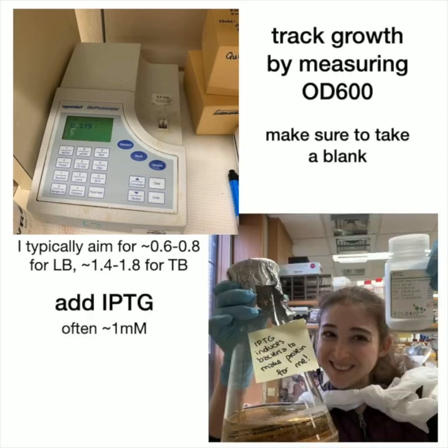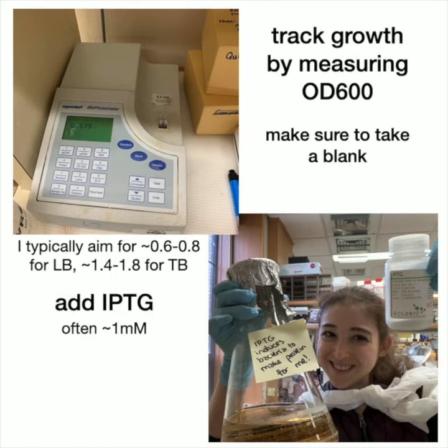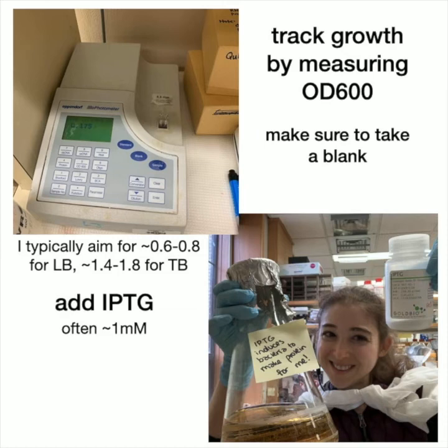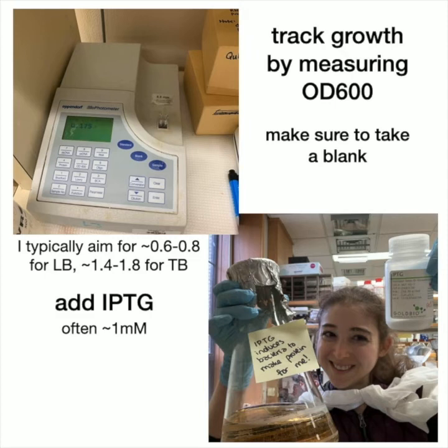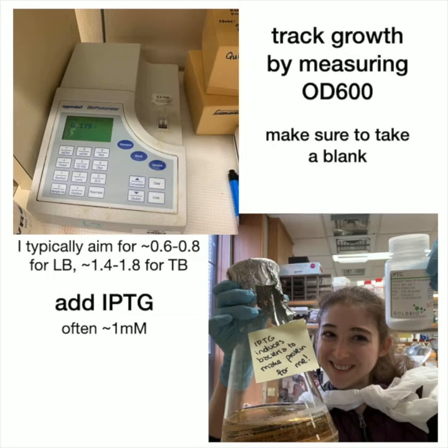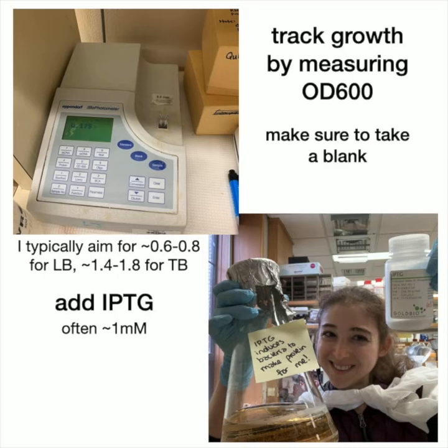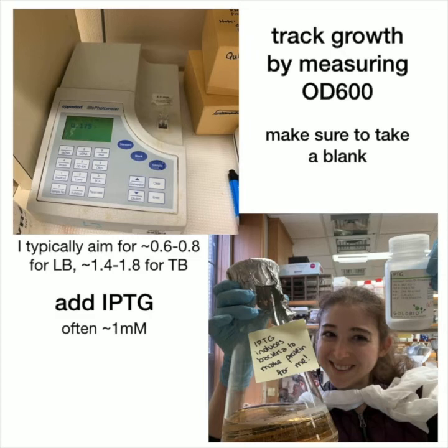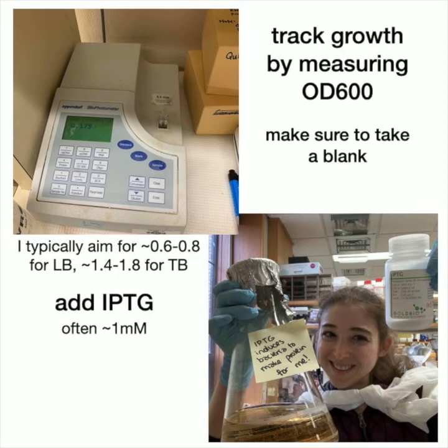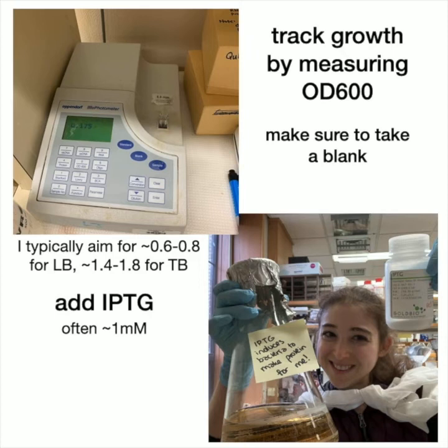Once it reaches that OD, I typically do the expression overnight at 18°C. I'll start cooling the incubator down when it's getting close to the OD value where I want to induce — sometimes I'll stick it on ice if it's getting too close, or just turn down the incubator to cool things off. Then I add the IPTG; typical values are about 0.1 to 1 millimolar. Another option is to do a shorter three-to-four hour growth at 37°C, which is what we typically use for growing starter cultures and the initial growth of the larger cultures.